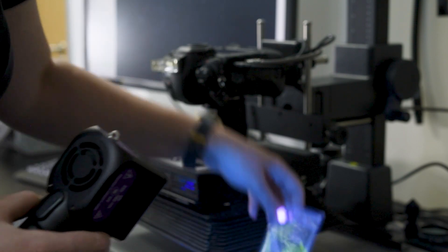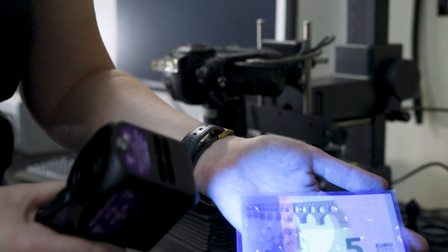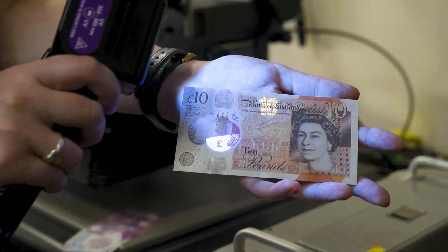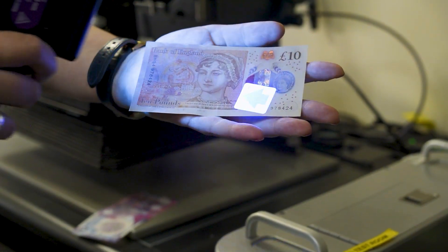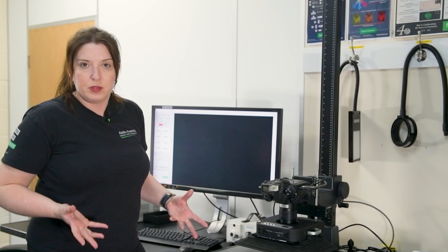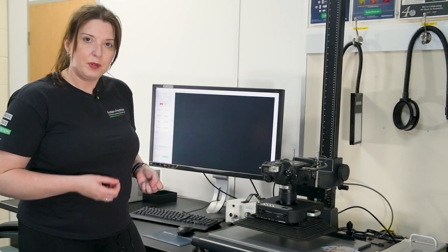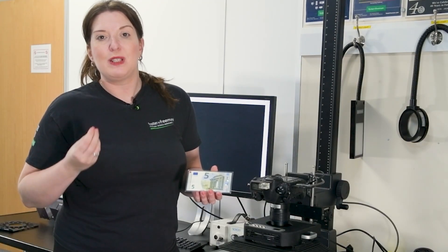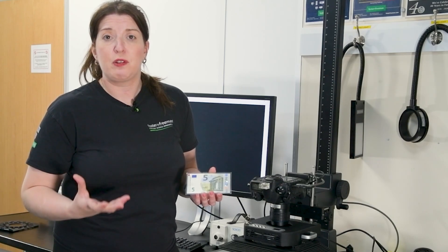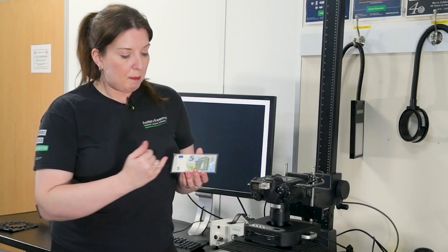Sometimes there are only a few small security features, and if your fingerprint is not over those areas it may be okay — but it is a consideration. Sometimes the methods that work on simpler sample types won't work as well on these more challenging samples. Let's look at different ways we can use lighting or software to visualise these fingerprints. Pretty much every banknote on the planet will have some form of infrared security feature where parts of both sides of the banknote could drop out under infrared.